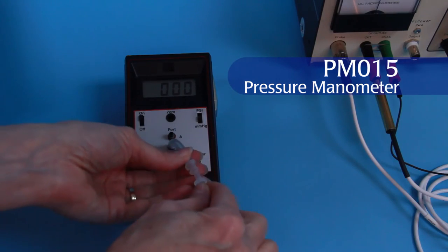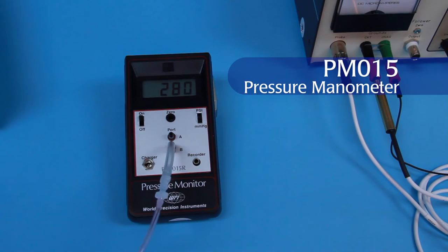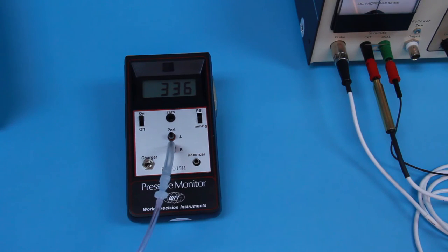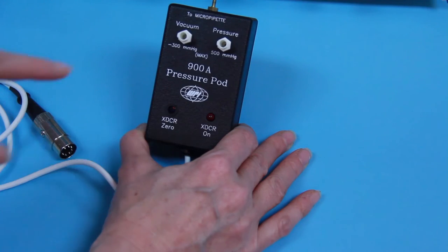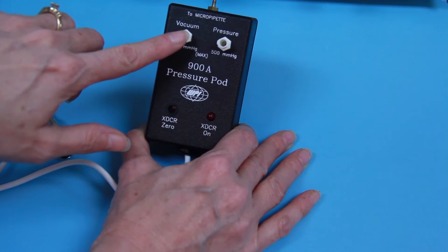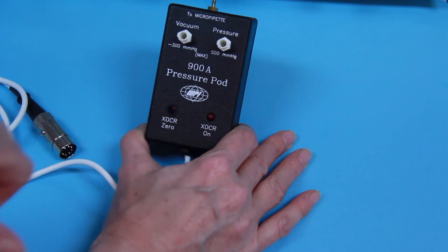By disconnecting the microelectrode holder and attaching the tubing to a manometer, you can check the calibration against a standard. The piezoelectric pressure controller regulates internal pipette pressure by controlling air flow into and out of a small pressure chamber.